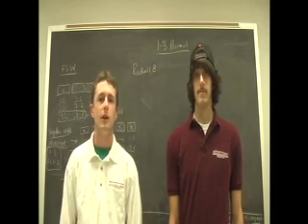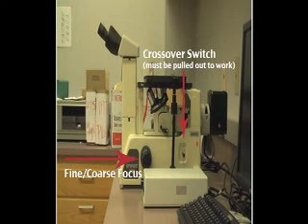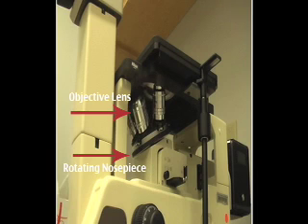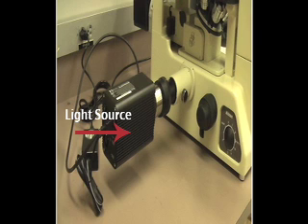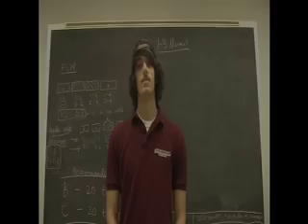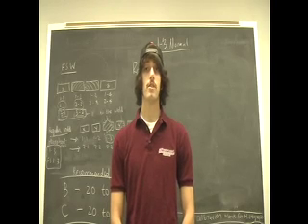First, we'll begin by showing you the basic parts of the microscope. Now that we've shown you the basic parts of the microscope, we're going to show you how to operate it and take photo micrographs using software on the computer.